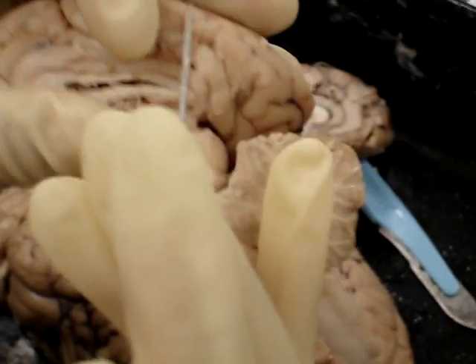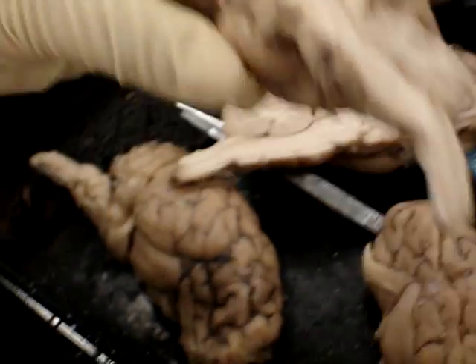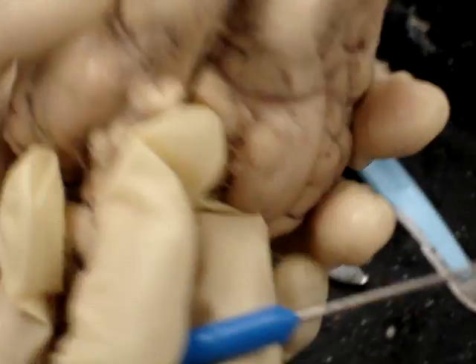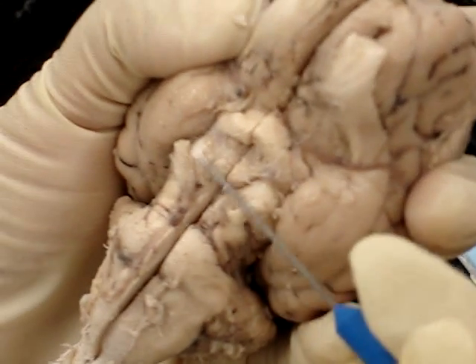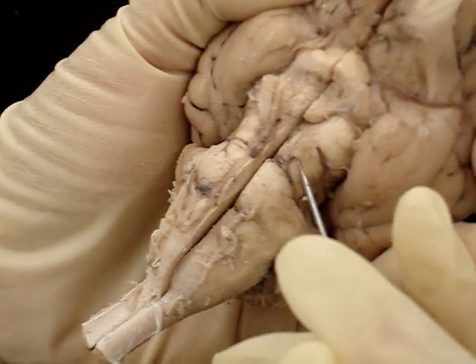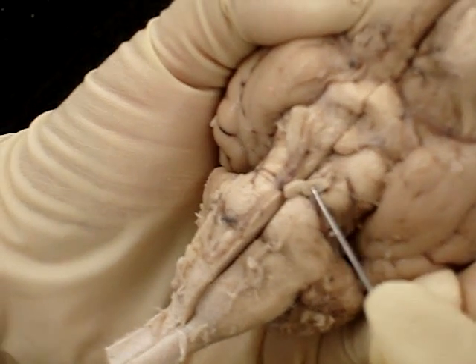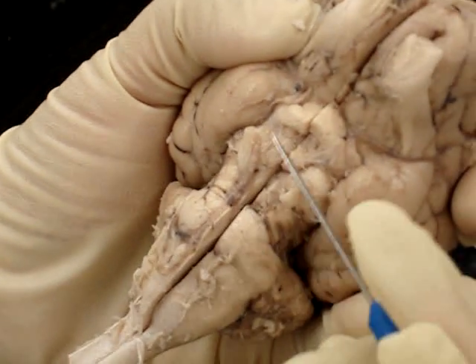The cerebral peduncle is this area. If you notice, the oculomotor nerve, or cranial nerve number three, comes out of it. So there's the cerebral peduncle.